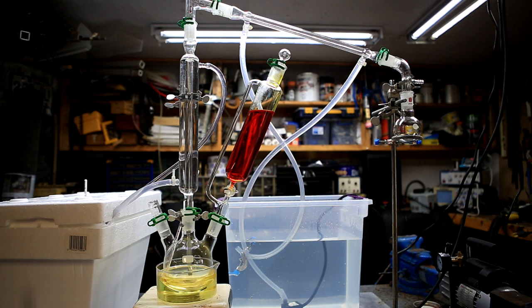This reaction requires a somewhat specialized distillation setup. To the middle neck is attached a condenser, but we're not running cold water through it. We're running 60 degrees Celsius water. The trick here is that the n-propanol, our starting material, boils at around 97 degrees Celsius.